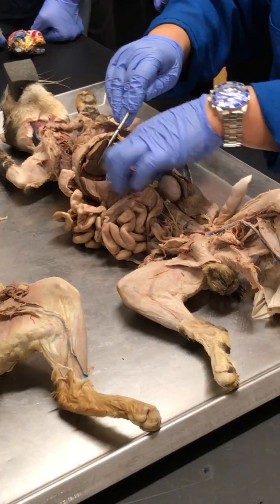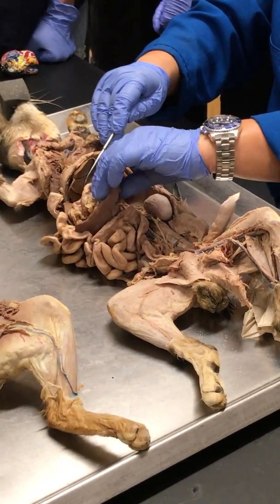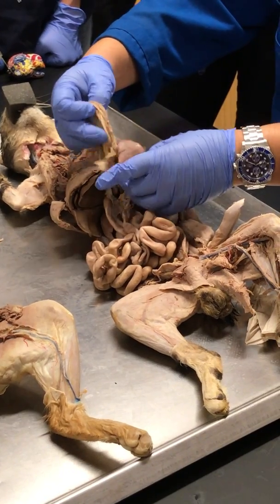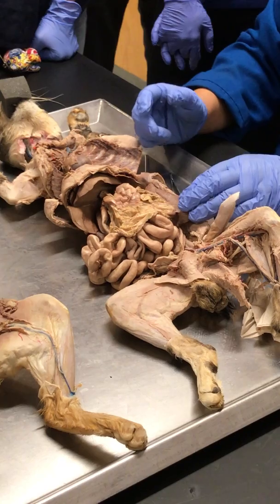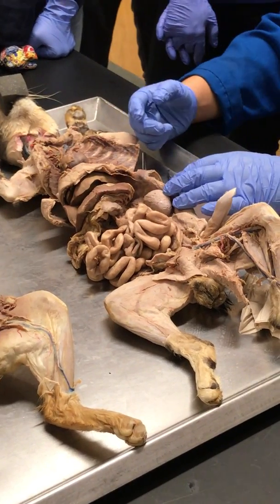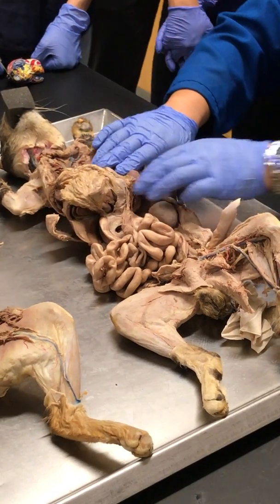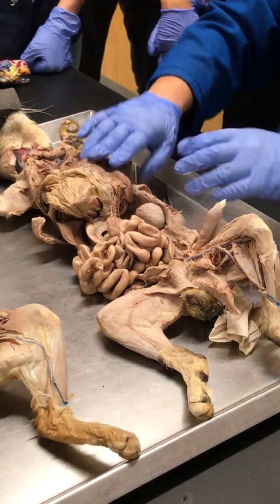We see that this here is the stomach. Yeah, this is a cat stomach. And hanging off of the cat stomach should be this thing known as the greater omentum. Right? And then greater omentum comes from the dorsal mesentery. This thing is the spleen. I flip this over, we now get to see a cottage cheese looking thing. See that right there? This is the pancreas as well.